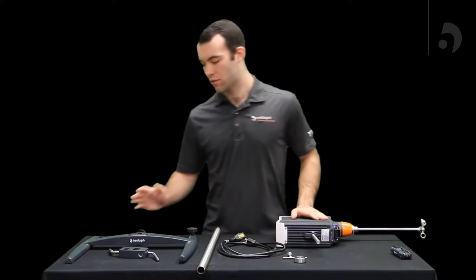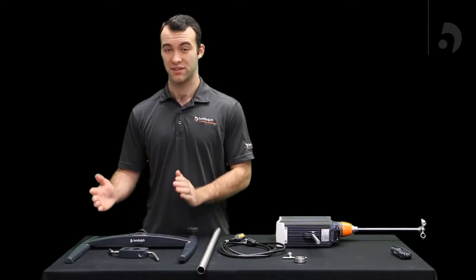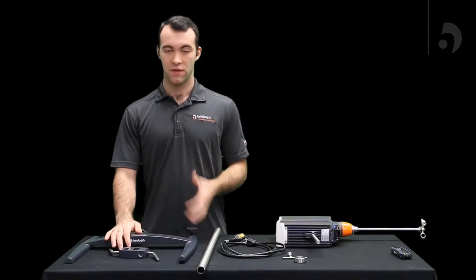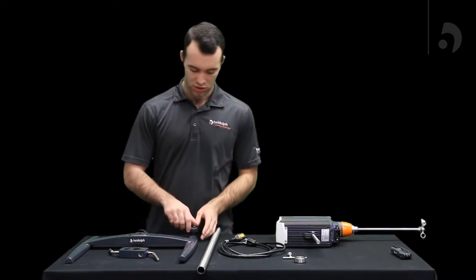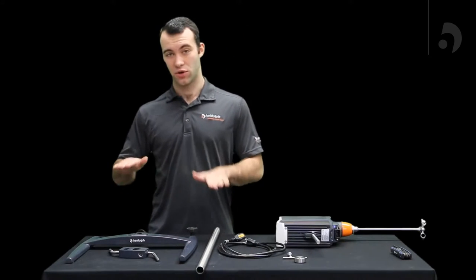Then once that's in you can move on over to your H-frame stand. First you're going to want to make sure that the H-frame stand is level on the table. If you find that it is off by a little bit you can use this knob here to adjust the height to get it to where it needs to be level.